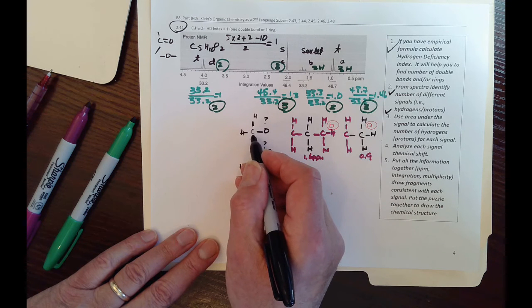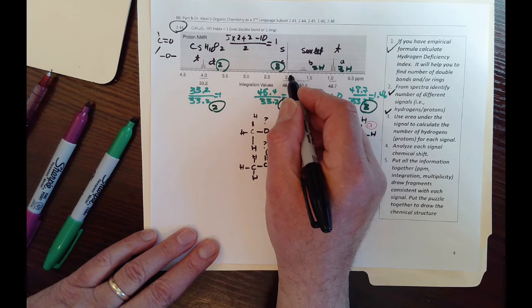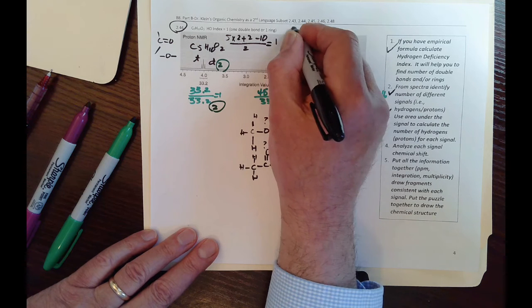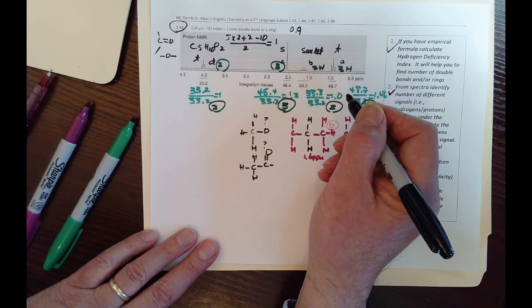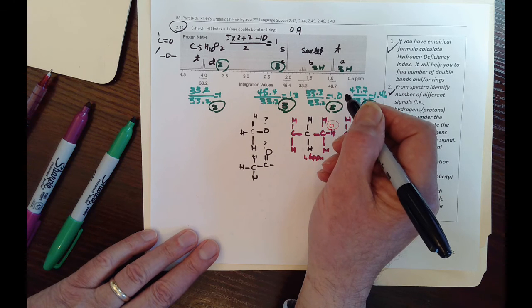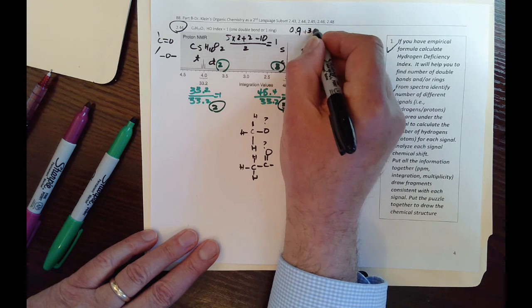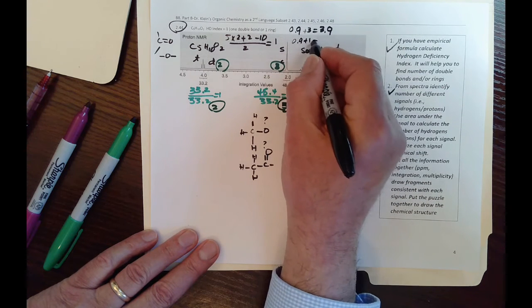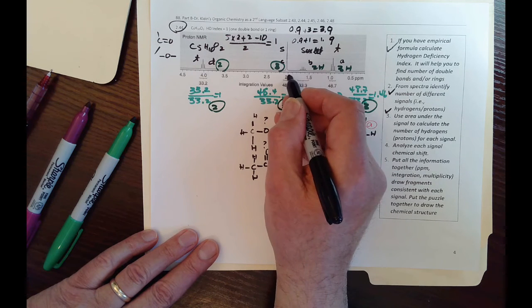So if you look at the methyl group, this CH3 is around 2 ppm, right? Remember, a methyl group is 0.9. If it was next to an oxygen, you would add close to 3 ppm to it. So this would have been 3.9. Now, if it was 0.9 plus 1, that's 1.9, and this, look at this, is close to 2, 1.9.